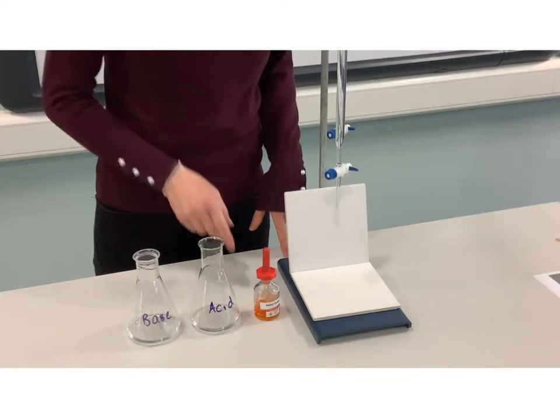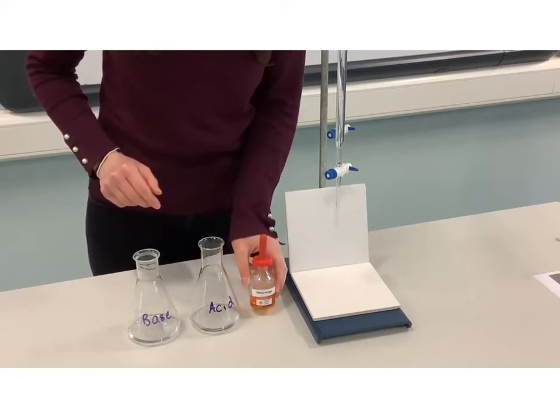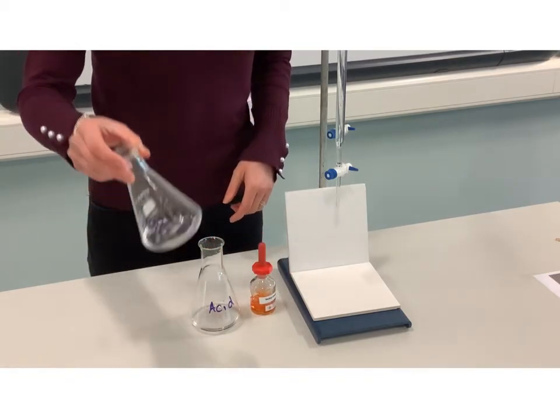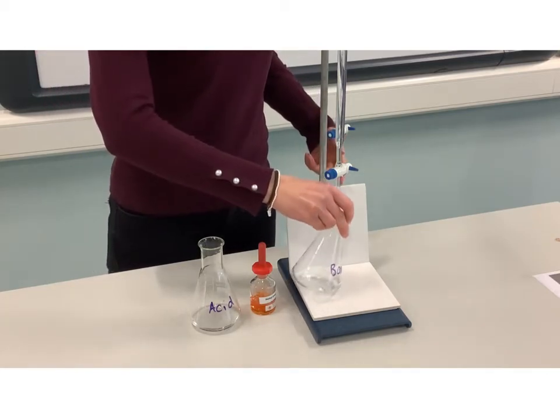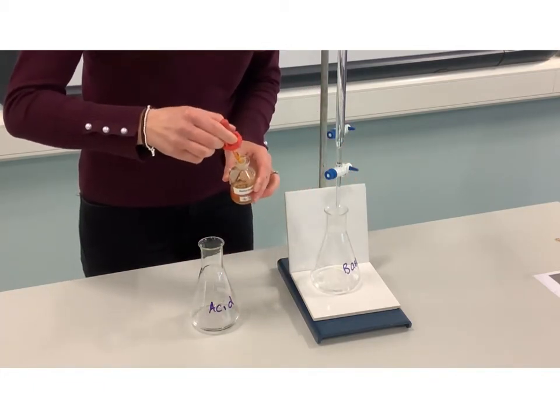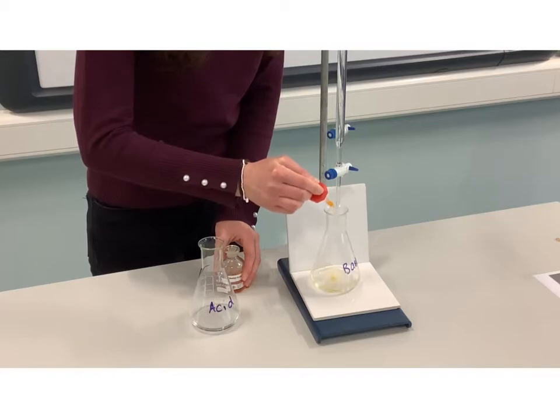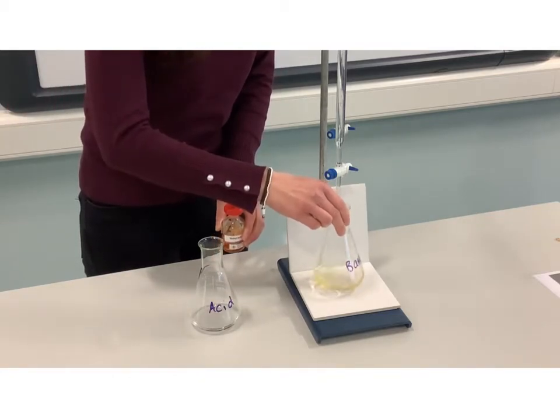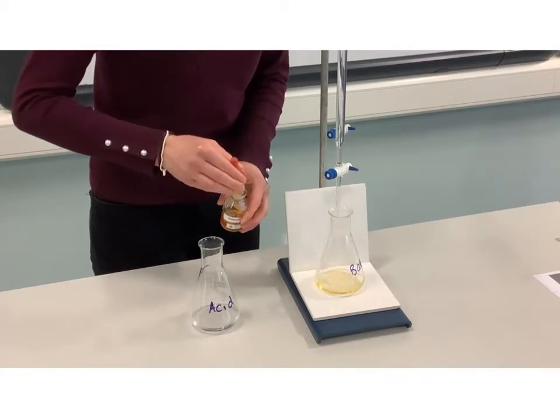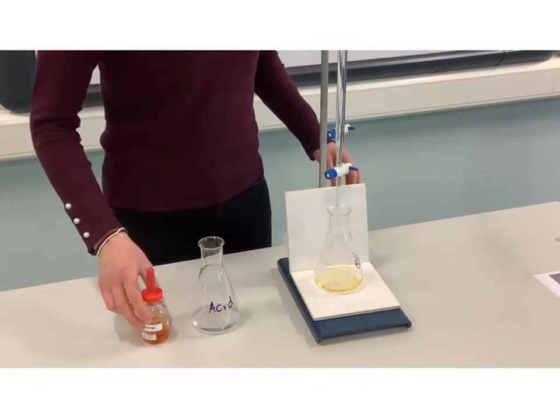Now I'm going to do the same process again but using a different indicator: methyl orange, which you may not have met before. You can see the indicator starts as a lovely orange color — hence the name. I'm going to start with base in the conical flask and add a few drops of the indicator. Remember, the indicator is always added to the conical flask. You can see we get a nice yellow color when methyl orange is added to your base, so the starting color is yellow.